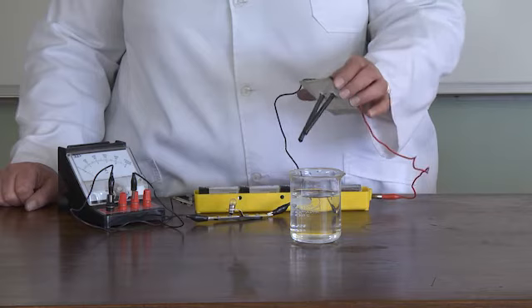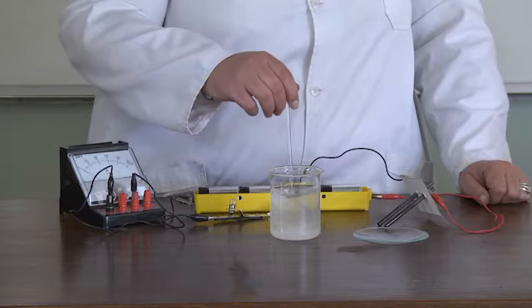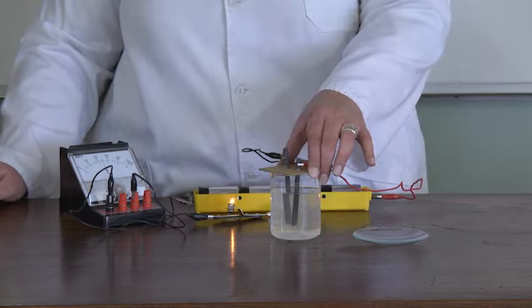Add some sodium chloride to distilled water and stir the solution until it's mixed properly. Place the electrodes in the sodium chloride solution. The light bulb shines bright and the ammeter shows that a current is flowing.